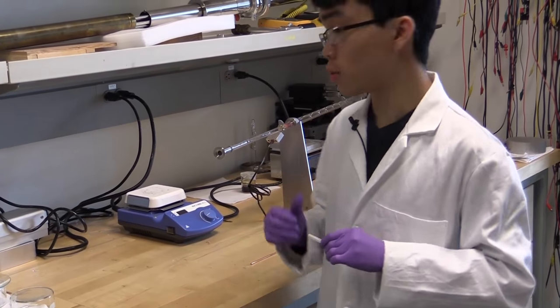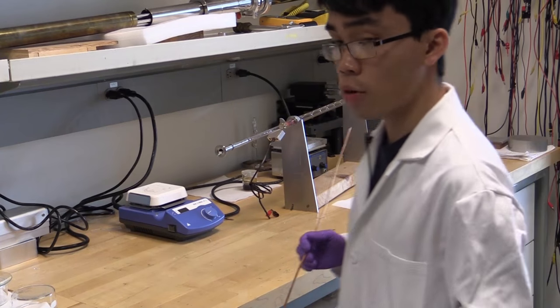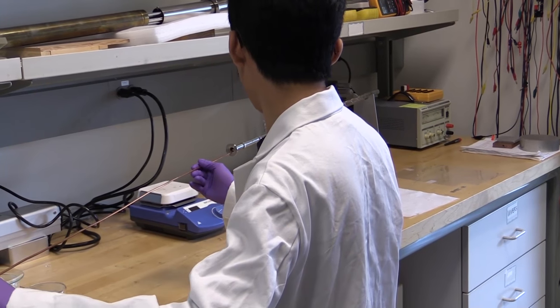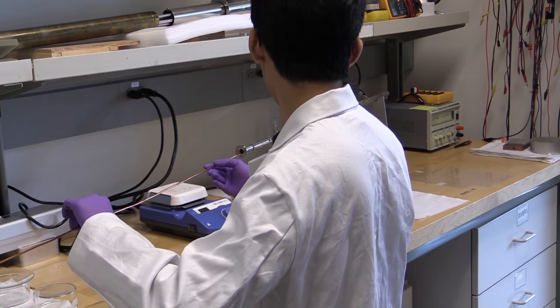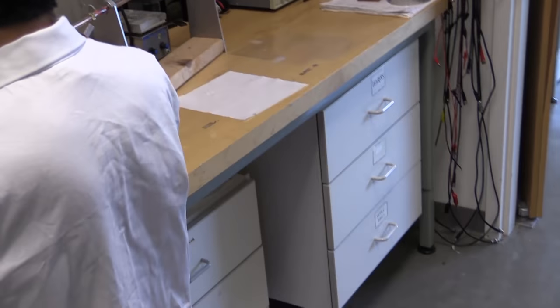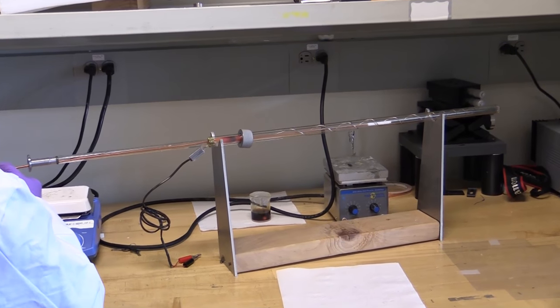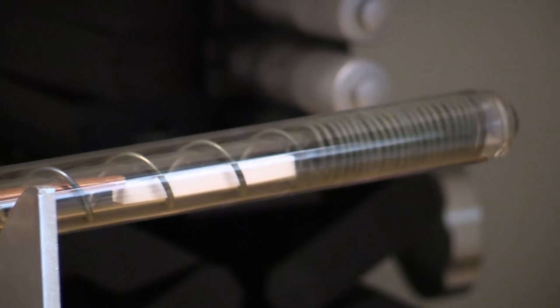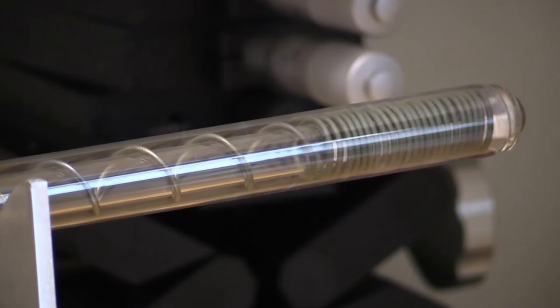Now we're just going to load the crucible into the tube. Since we want the tungsten oxide to be at a lower temperature, since it sublimates at a much lower temperature than the tungsten selenide, we're going to load it first towards the cooler end of our coil, being very careful not to cause the crucible to tip over. And there we are, ready to go.